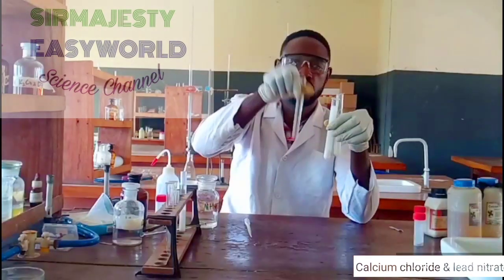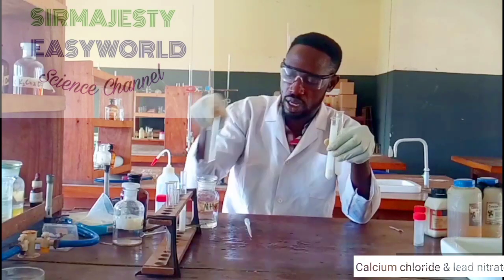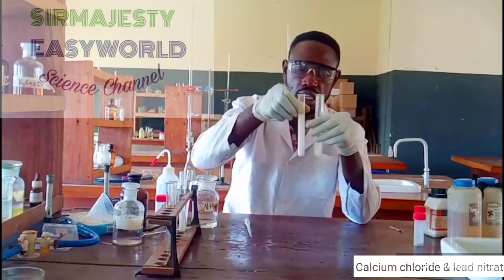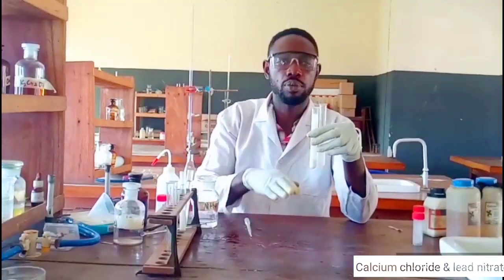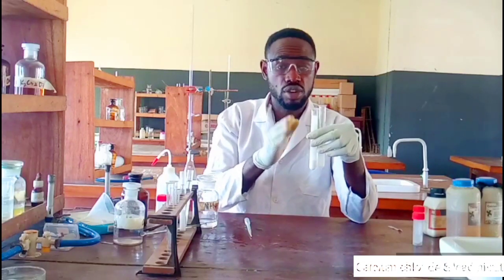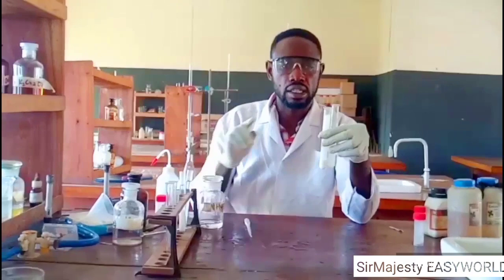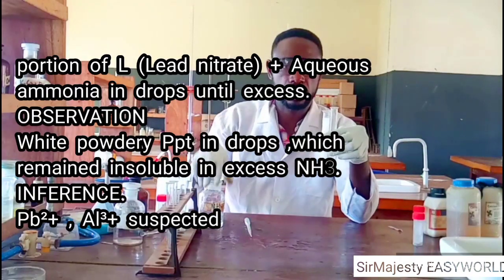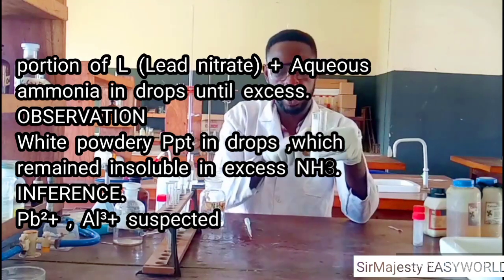It will not dissolve. This one was the result we got with sodium hydroxide, where lead dissolves in excess sodium hydroxide. The same lead persists in excess aqueous ammonia. Reason: lead is not a transition metal and doesn't form a complex ion with ammonia, unlike zinc. Meaning zinc will dissolve in excess aqueous ammonia, but aluminium and lead will not dissolve.